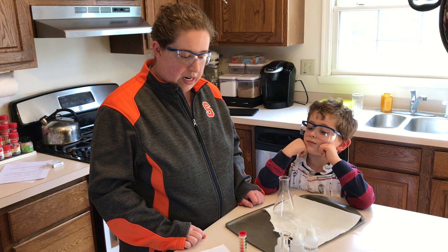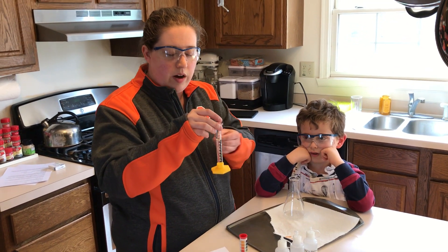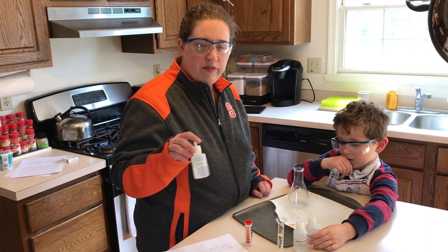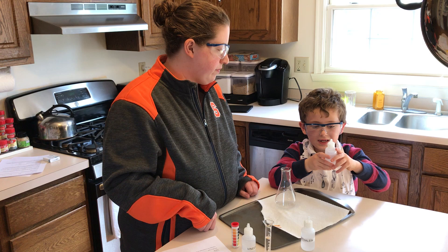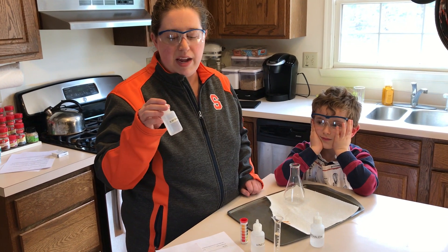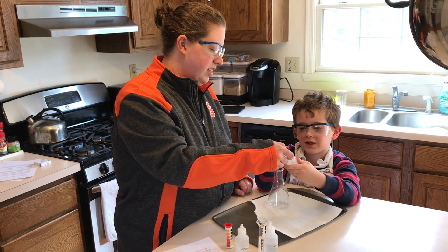So let's talk about the equipment today. This is an Erlenmeyer flask and it's empty right now. We have a graduated cylinder with 10 milliliters of water. If we were in the lab at school I would use distilled water, but we're just going to use tap water from the sink today. And then we have three chemicals. We have vinegar right from the store — I don't know the molarity, I don't know how strong it is. This is 0.50 NaOH, so this is the base. Obviously vinegar is the acid. We know the concentration: it's 0.50 molar sodium hydroxide.